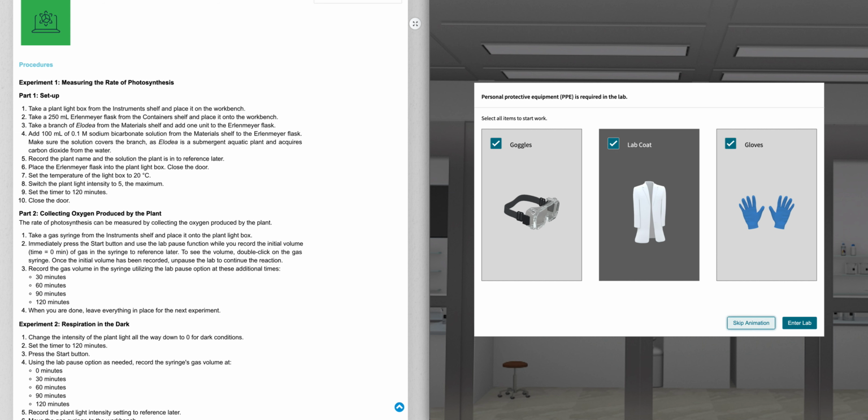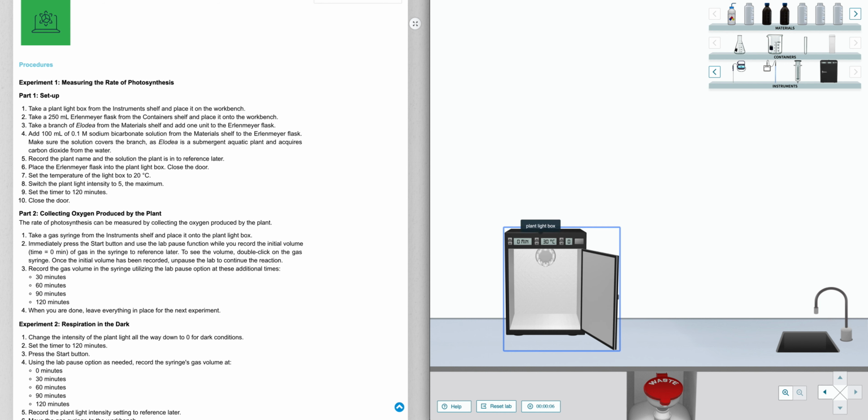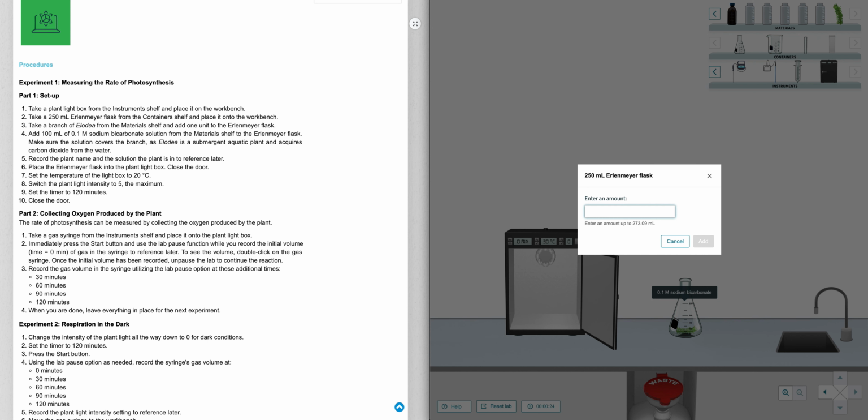So open your lab simulator by clicking the icon over on the left and then enter the lab with your PPE. I'd usually skip the animation. The very first thing you're supposed to do is pull down a light box, and then grab yourself a 250 ml Erlenmeyer flask. Step 3 says grab some Elodea and put that into your flask. And then in step 4, put in 100 milliliters of 0.1 molar sodium bicarbonate.